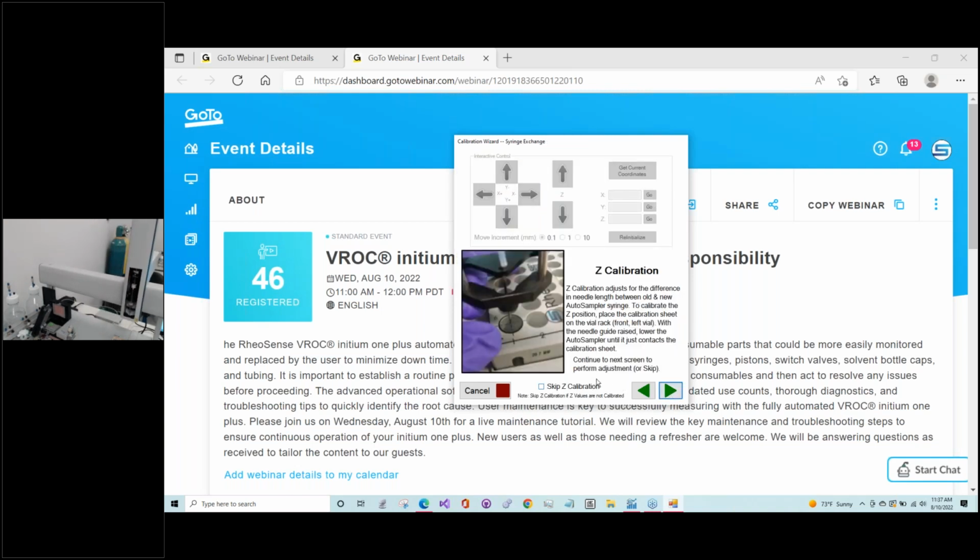And it's generally not necessary to redo this Z calibration. So you can skip this. Just a quick discussion on this. Generally, just changing this out, because of the way the seating is fixed, you don't have to do this Z calibration.